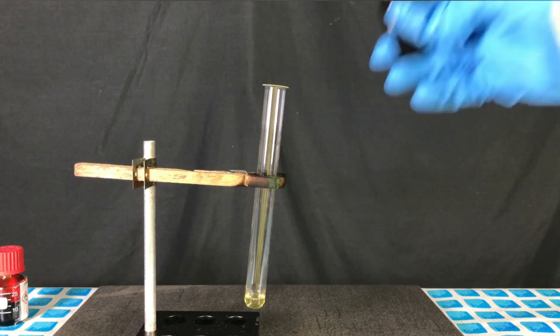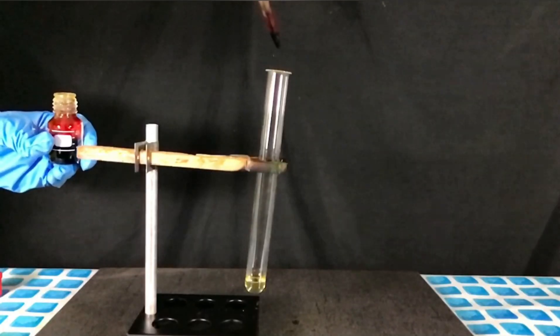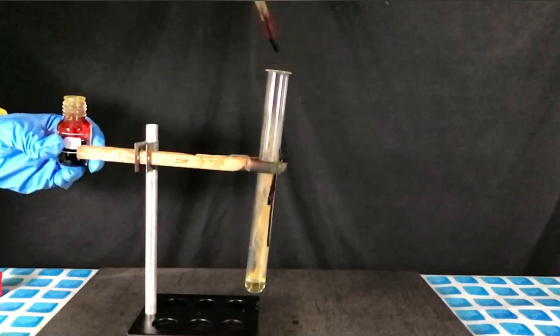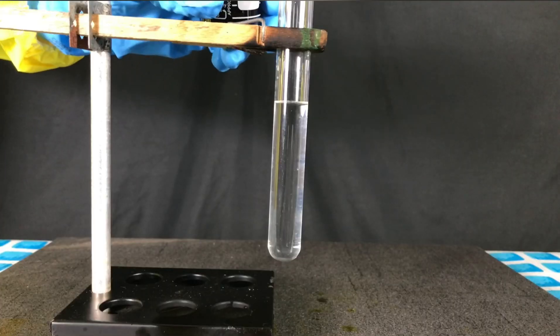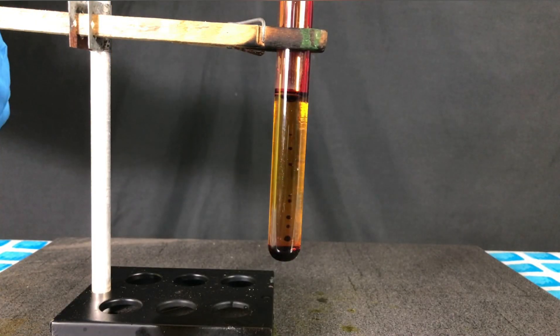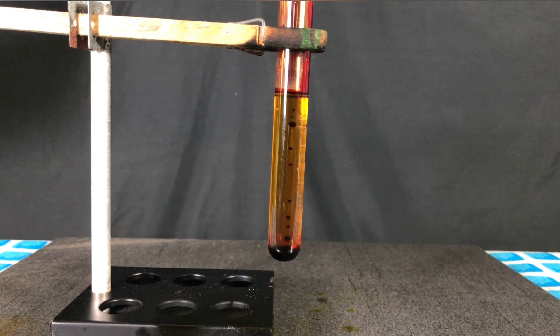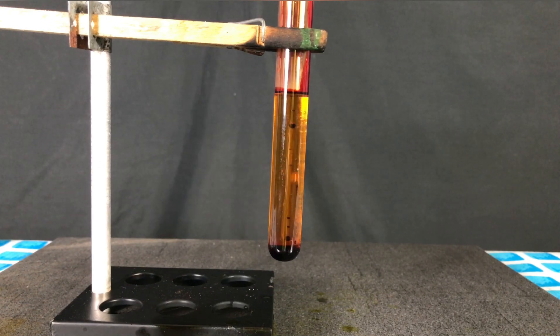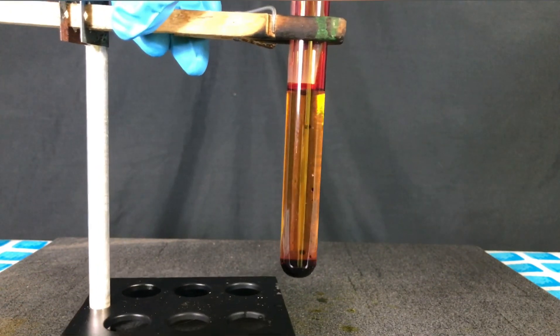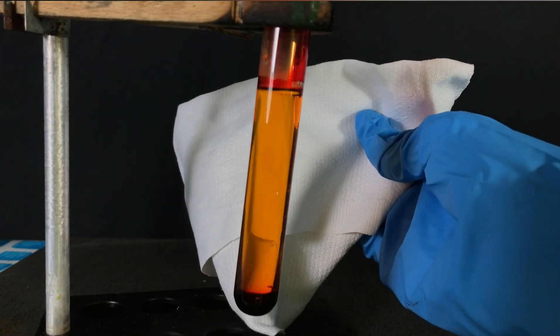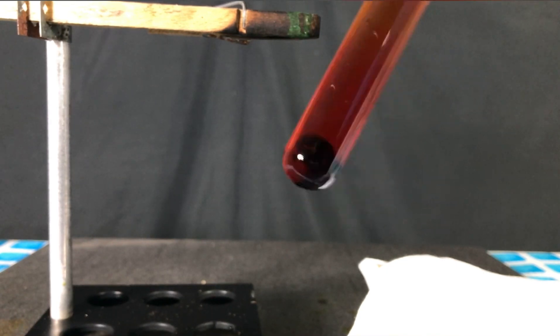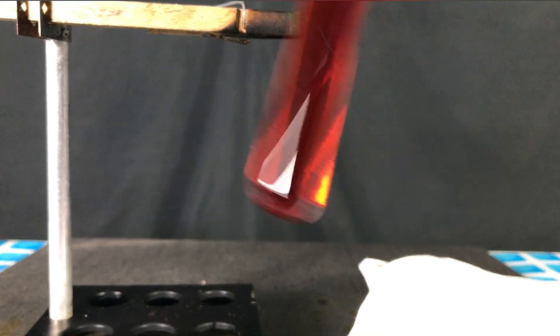We added what looked like 1ml of homemade styrene. I might actually show you how we made styrene in a future video. Let's see this again. I wanted to make something that looked like a lava lamp so I simply added some chromyl chloride to a test tube containing distilled water. Unfortunately all the chromyl chloride sank to the bottom and it didn't really want to dissolve. Occasionally there were some hydrogen chloride bubbles but that was it. Upon shaking it bubbled profusely until it all dissolved. The contents of the test tube looked delicious but you shouldn't drink this cancer juice.